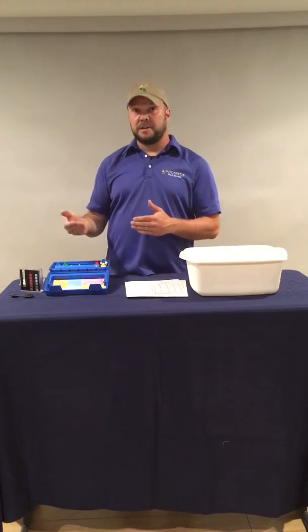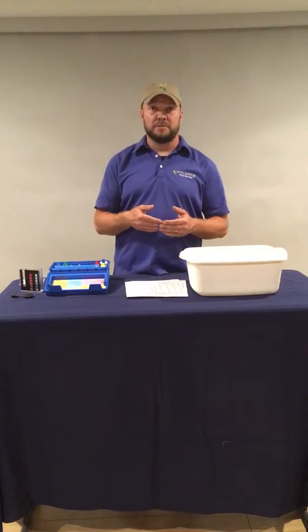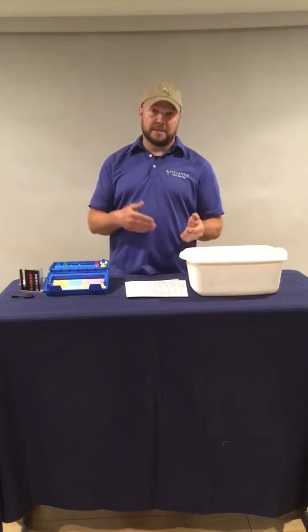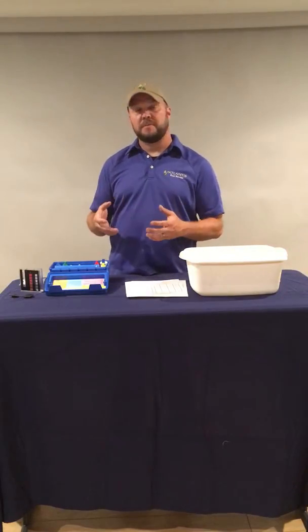In that situation, if you have that type of test kit, you want your total chlorine to be the exact same as your free chlorine, which would indicate that you have 0 combined chlorine. This test kit, unlike some of the other ones, can actually test for free and test for combined, so we don't worry about the total, because the total is sort of a made-up term anyway.